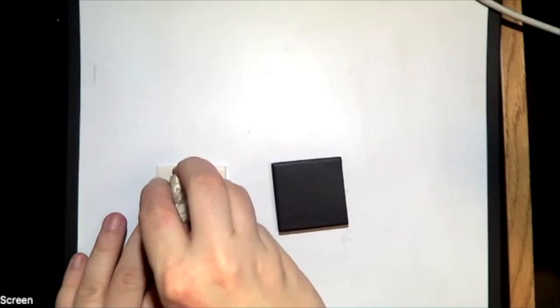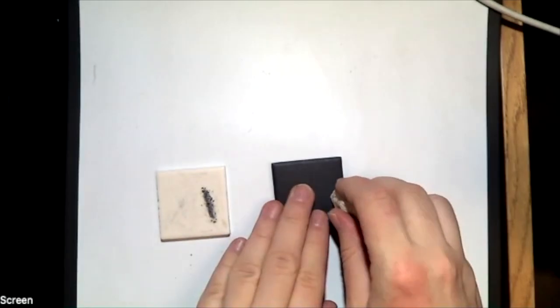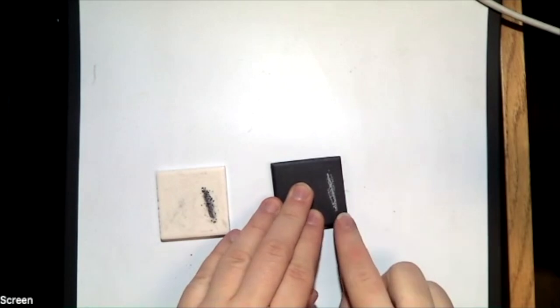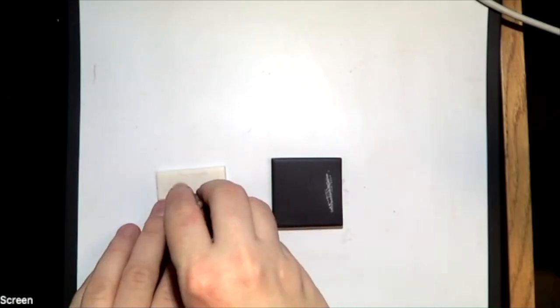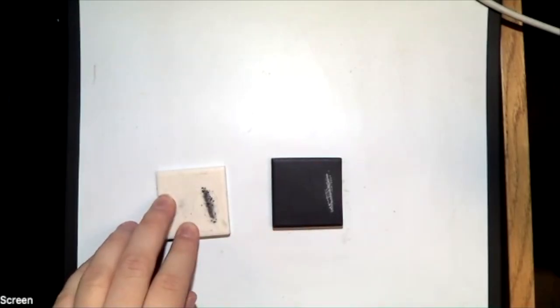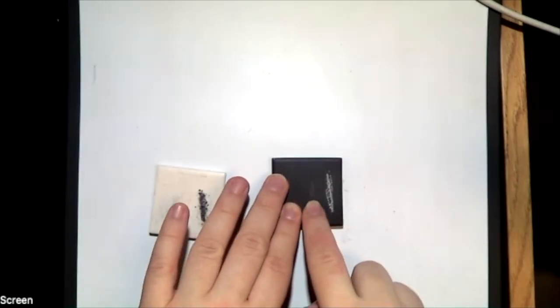You could have something happen like this where I'm going to do the same thing. You can hear there's quite a lot of effort put into that, and I don't see anything. That's when I want to move on to the dark one and do the same thing. I see that I have a white streak left behind. I could also end up with a sample that I try really hard on here. I don't see anything. I move over here and I get at most like a light trail or even no trail. That's going to have to do with the hardness of our mineral, which is our next test we do.